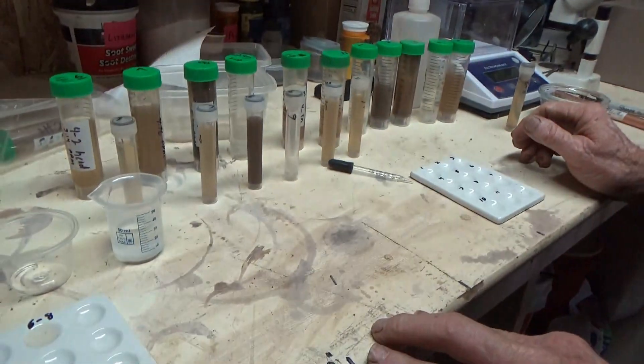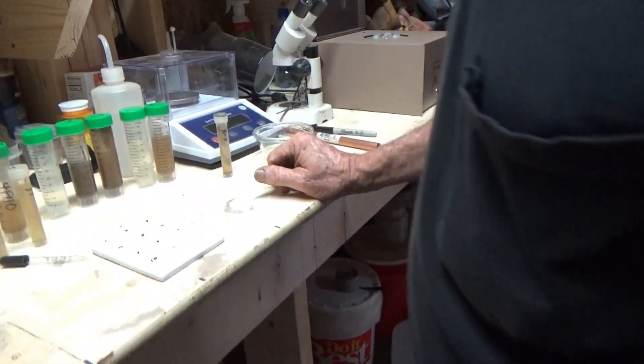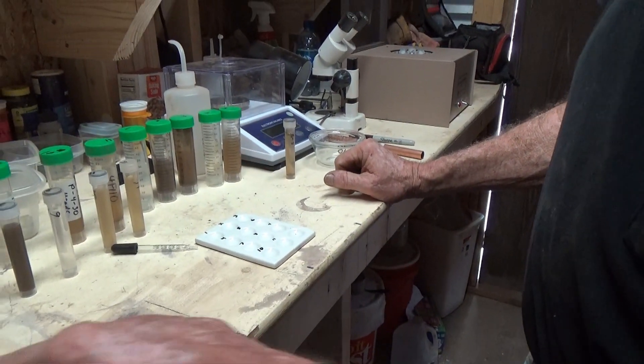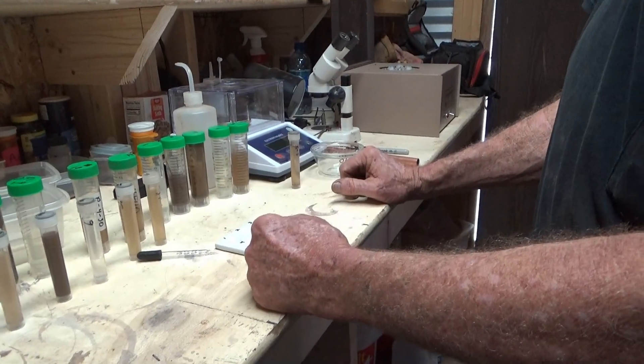Now fill up the rest of the wells and we'll see what this looks like when it's all dried out. I thought you were going to be filling that one since that's the one that's all numbered and this one is not.